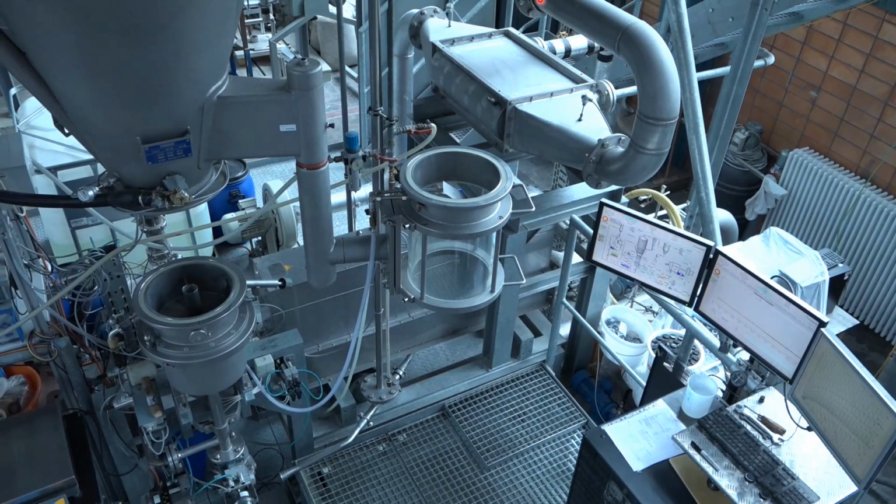The exhaust gas is coming with a high moisture content and still some temperature to this heat exchanger. It is cooled down, so the moisture is getting out, and after this the process gas is heated up in our electric gas heater, and then it is coming back to the process chamber.